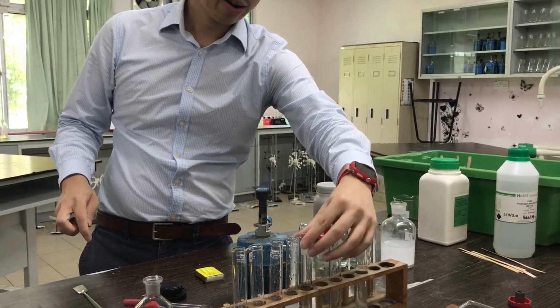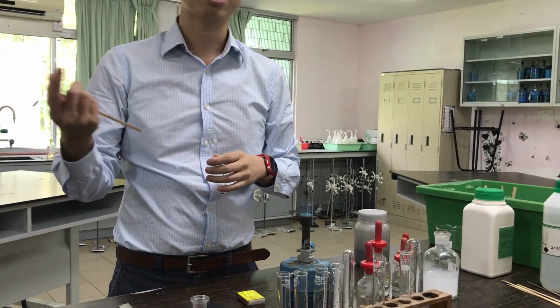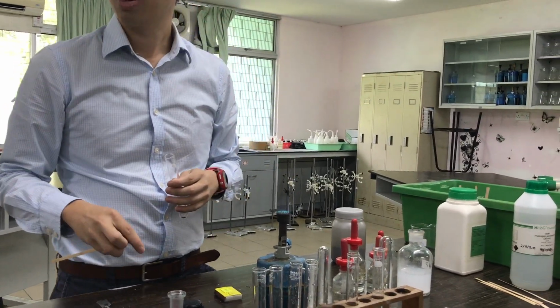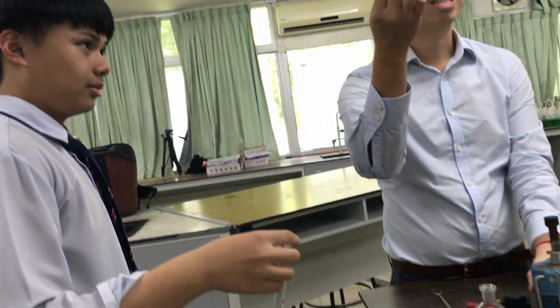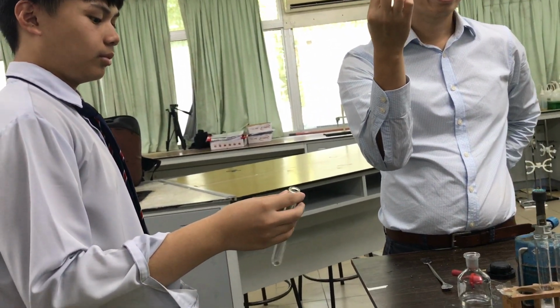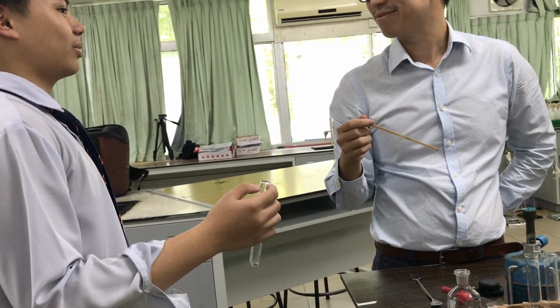Where was it? Oh yeah, magnesium is here. Someone want to do this? Who wants to do it? Yes, Hadiru, come. So on one hand you hold this. Why do I need a wooden splint? Because I'm going to test for the gas, right? Test for hydrogen, what do I use? Test for hydrogen gas.